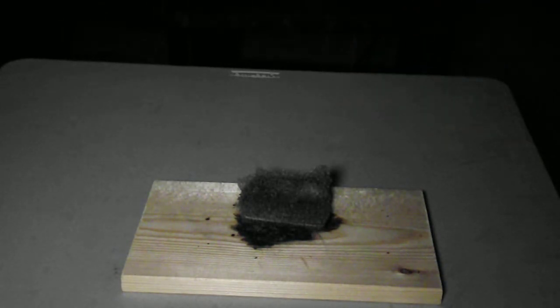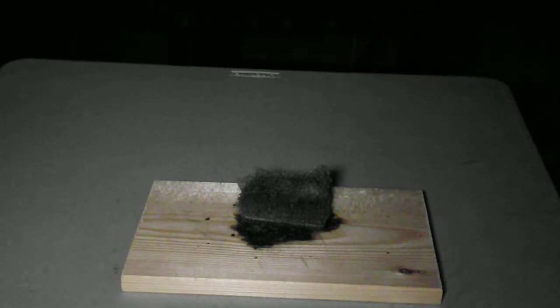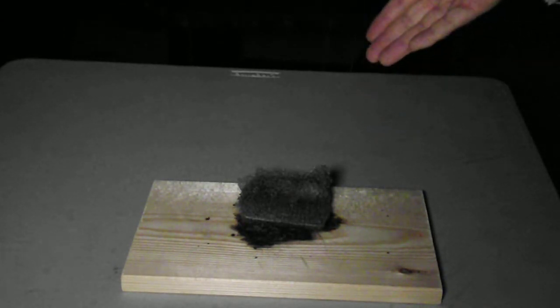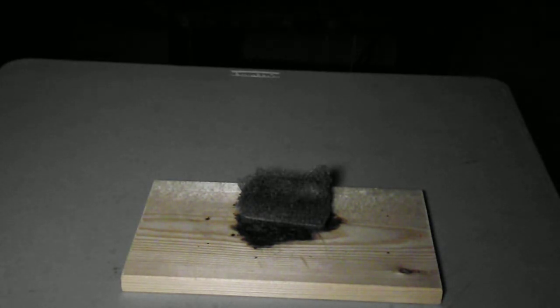Steel, as you know and have observed in the world around you, does ultimately rust — it does oxidize — but it takes years for the metal on an automobile to oxidize. By forming steel wool, I've dramatically increased the surface area.